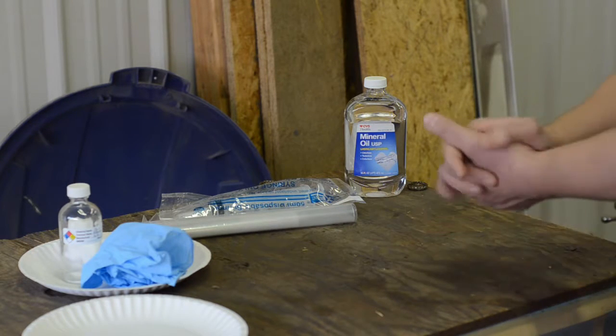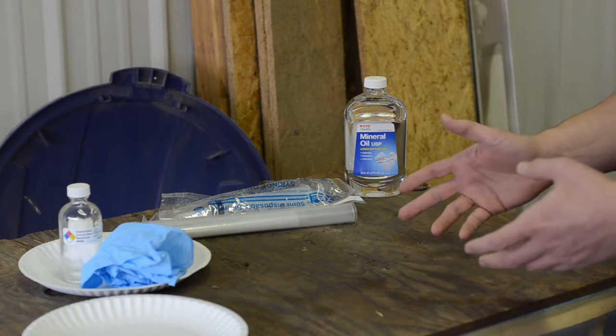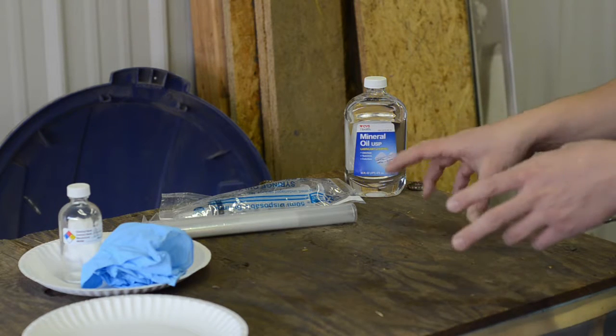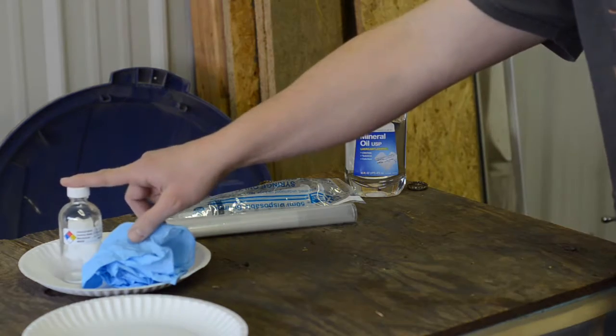Now, right now it's improperly stored, so I've done a lot of reading and research, hopefully from the right sources, and we're going to take the mercury out of the container that it's in, mechanically filter it, and then put it into its new home right here.